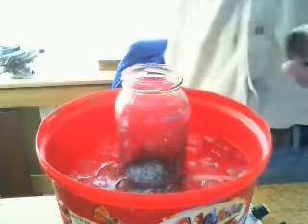That's been stirring for half an hour. What you're going to do next is add 15 grams of potassium permanganate — these are the purple crystals you can get from local chemists. You need to add your 15 grams over an hour, and the reason for that is to keep the temperature of the reaction down. If you add it all in at once it's going to get very hot and spoil everything. So you put a little bit in, keep stirring, and add a little more over the course of an hour — about one gram every three minutes. Once all your potassium permanganate is in, you leave it stirring for another hour, so it stirs for two hours total.